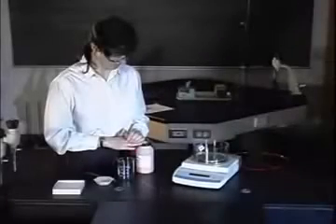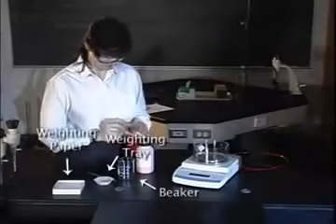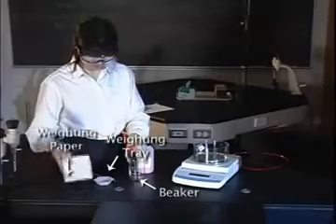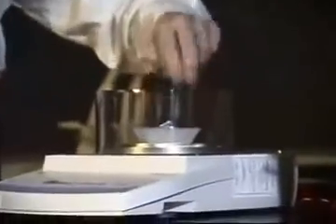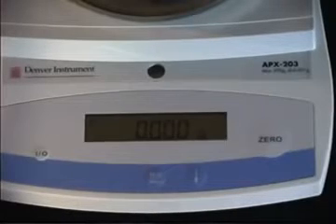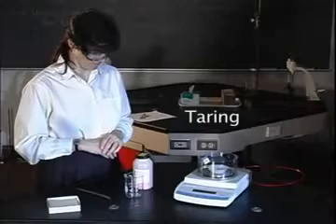Never weigh chemicals directly on the balance pan. Use a beaker, weighing paper, or a weighing tray. We will use a weighing tray. Gently set the weighing tray on the balance pan. The balance can be zeroed again with the weighing tray in place so as to obtain the net mass of the sample. This is referred to as taring.